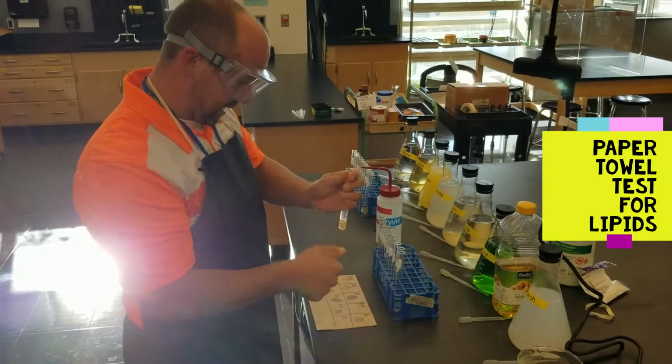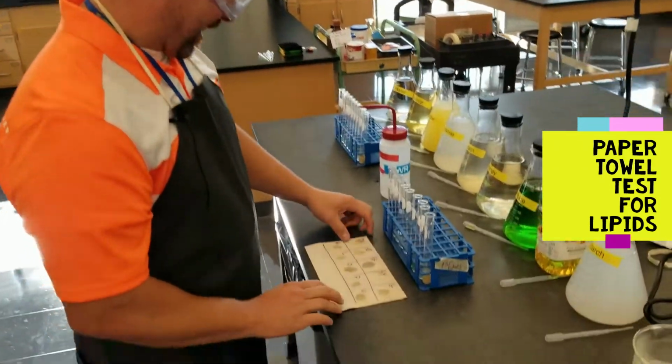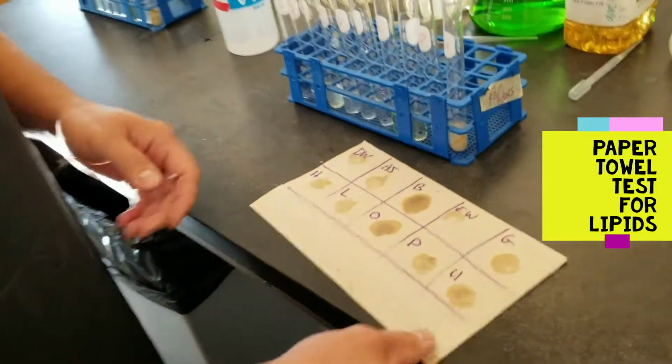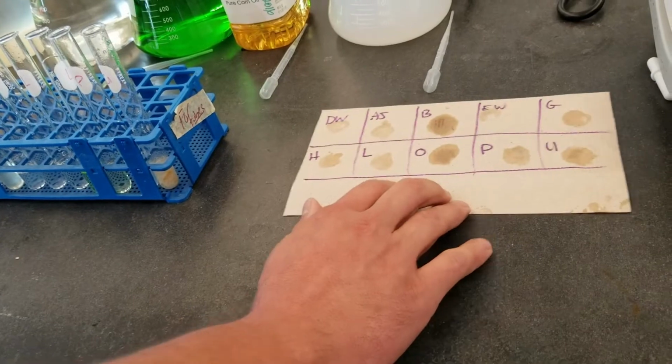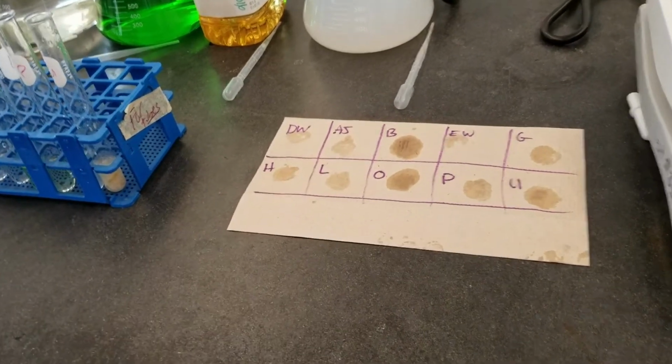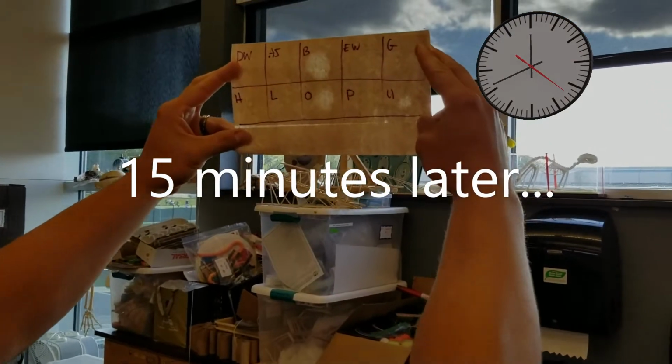And the last one's the unknown. Who knows what's in there? All right, so we're gonna have to set this aside for a little while and give it time to dry, and we'll see which one ends up being translucent. It's been 15 minutes and now our paper towel is dried.